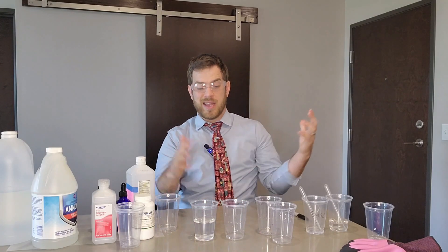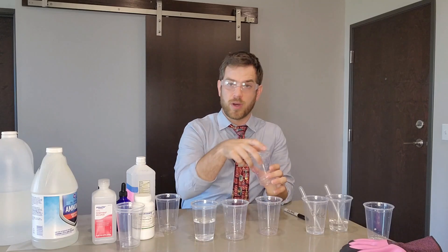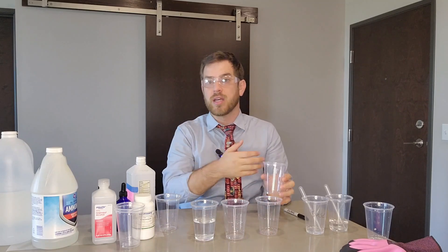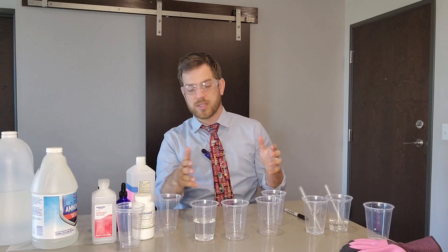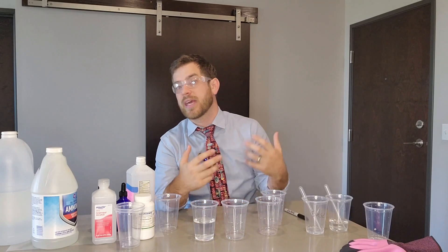At this point I messed up, so I empty out all my cups, rinse them out or wipe them with paper towels. Then I get a fresh container of water, add phenolphthalein, and try again. That last run is the only one that counts — you can handle it however you want.